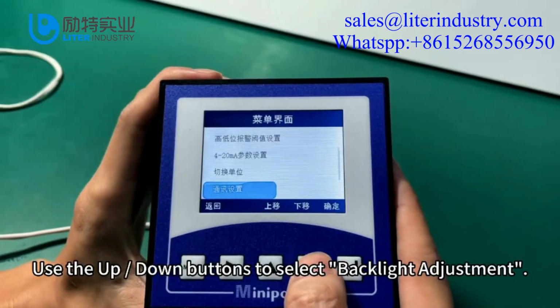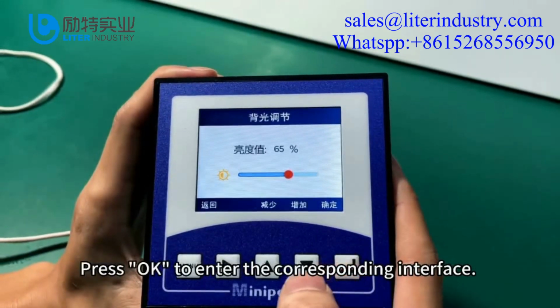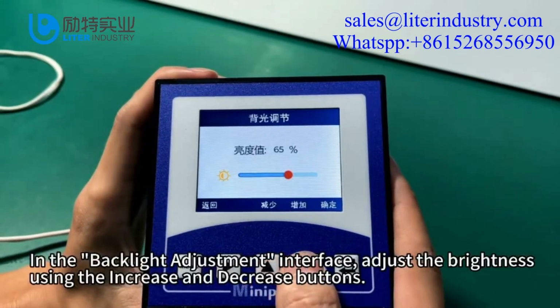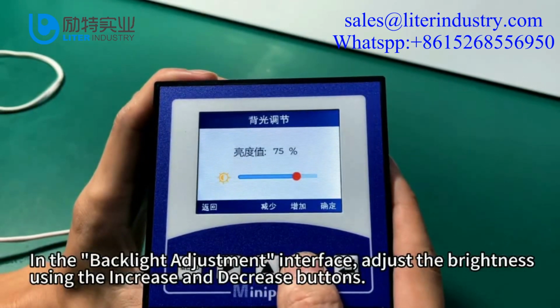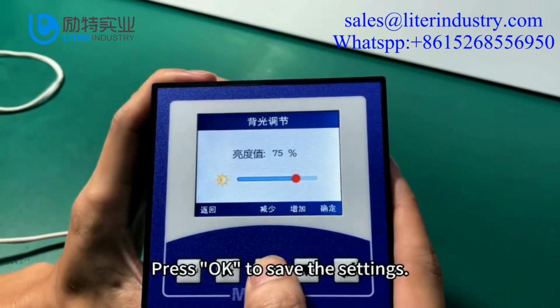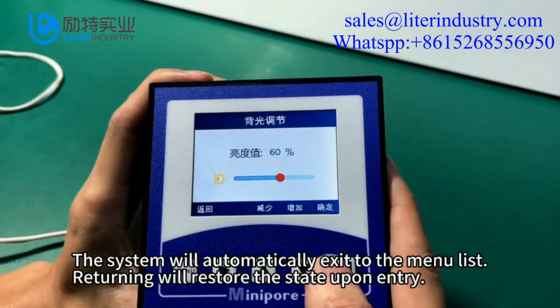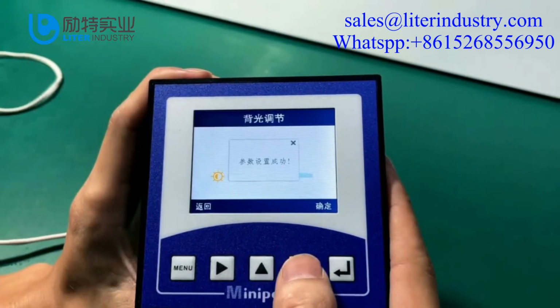Use the up-down buttons to select backlight adjustment. Press OK to enter the corresponding interface. In the backlight adjustment interface, adjust the brightness using the increase and decrease buttons. Press OK to save the settings. The system will automatically exit to the menu list. Returning will restore the state upon entry.